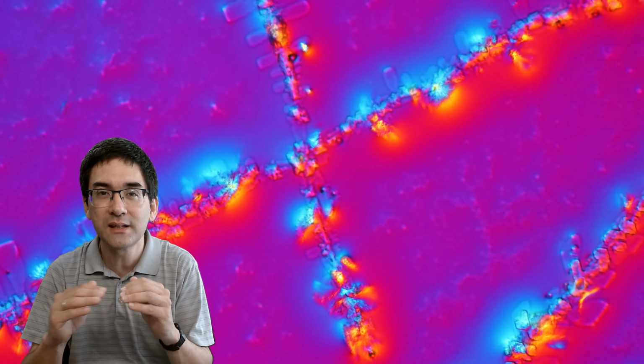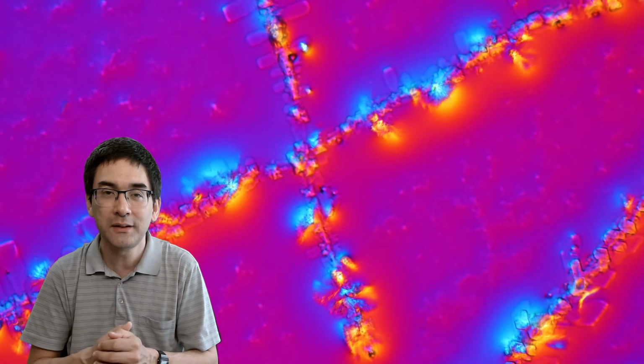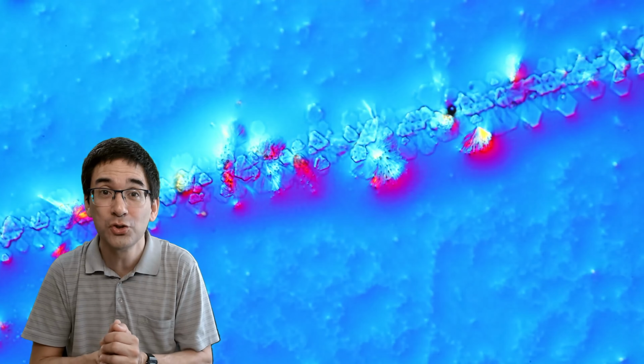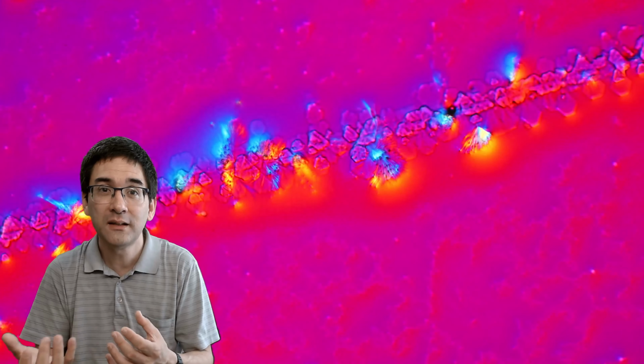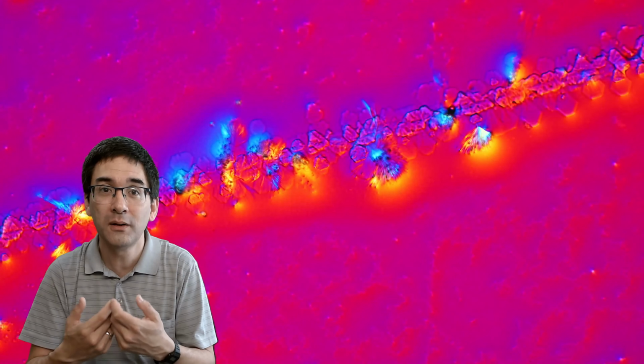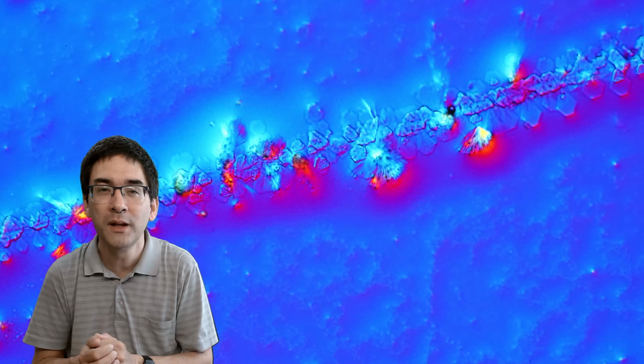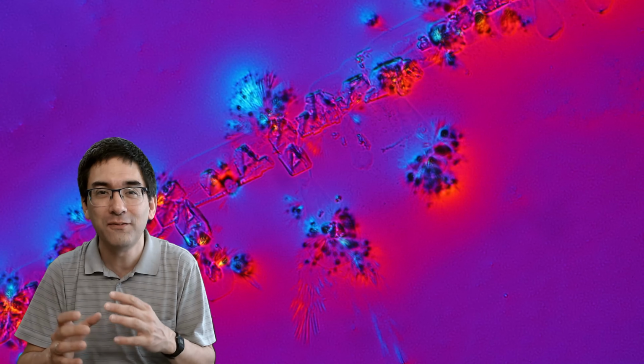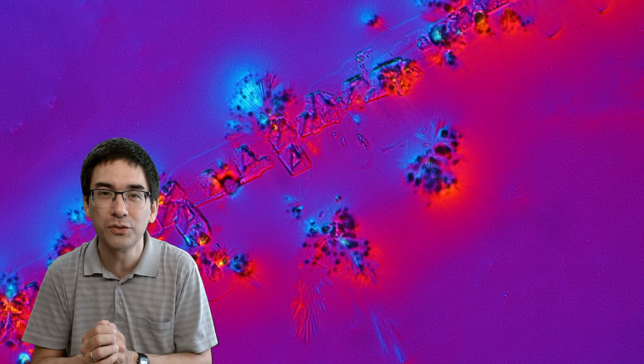And here, this is a microscope slide with some dried urine, and you can already see with your unaided eye that there is some kind of deposit on the slide. Now, you might wonder about the color. Why is it so colorful? Well, my microscope is equipped with a polarization system and also prisms that give me these colors. But later, at the end of the video, I'm going to show you some crystals under oblique illumination. It's a very cheap filter that you can even make yourself at home, and then you're also able to get very beautiful three-dimensional looking crystals.